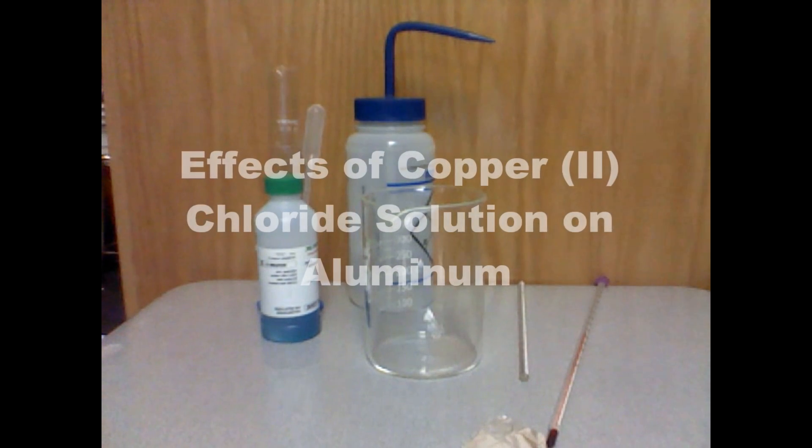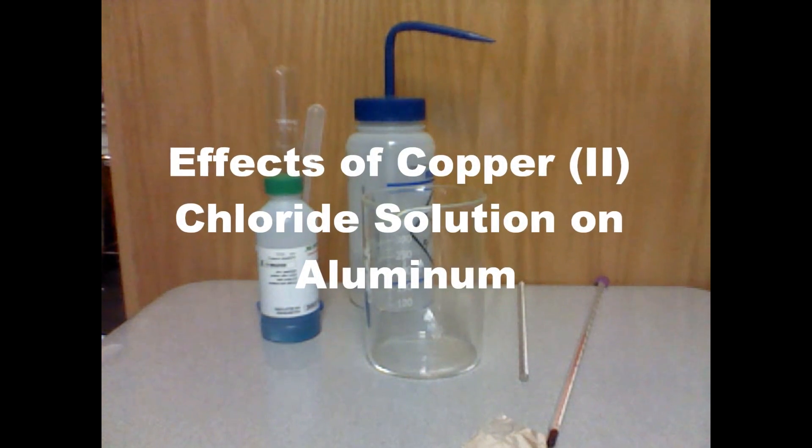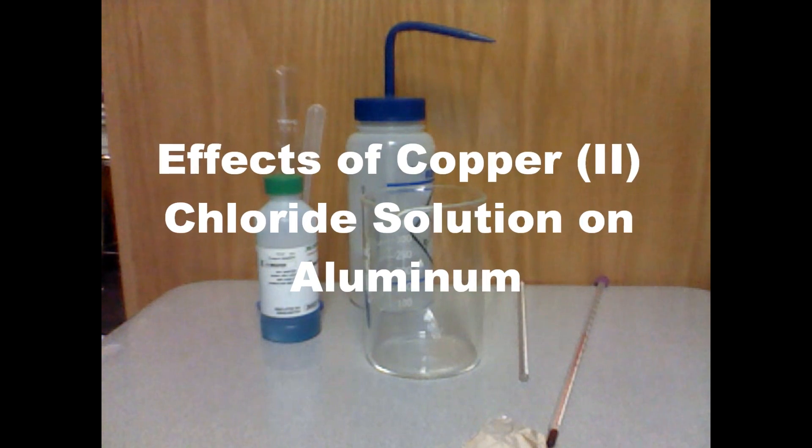In this experiment, we will watch aluminum foil disappear as it is added to a green-blue solution of copper(II) chloride.